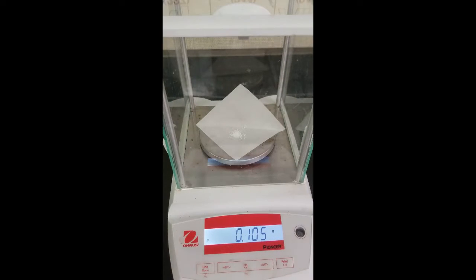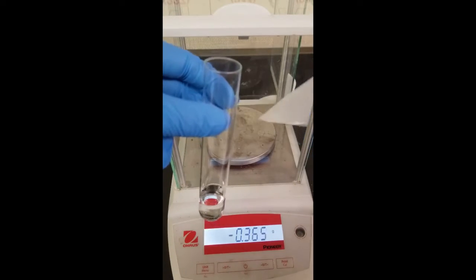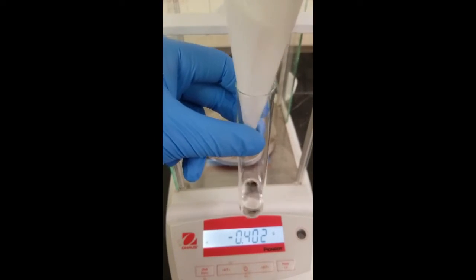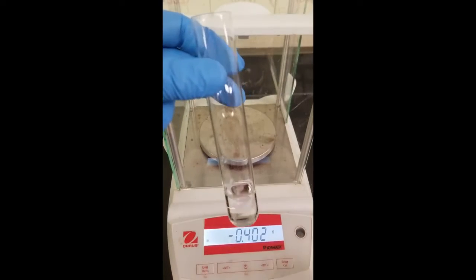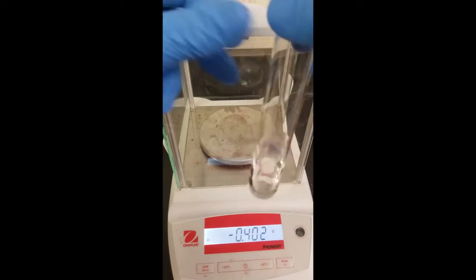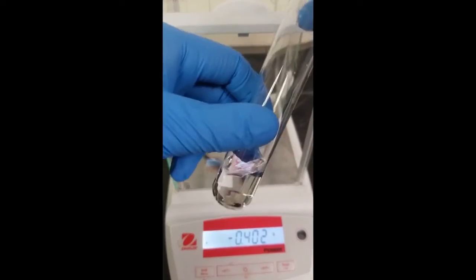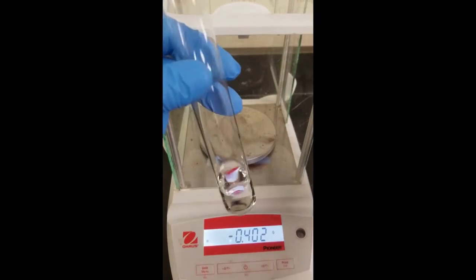All right, so there we go. We got some of our unknown. And then we'll pour this into our test tube. And make sure to get it all in there. You see how folding the weigh paper earlier helped us transfer. Always think ahead. And then you just want to give it a little swirl, just make sure to get all the solids nice and dissolved. Otherwise, you're going to get some error in your experiment. And you can use your copper stir bar to make sure everything is nice and dissolved. And now we're ready for trial 2.